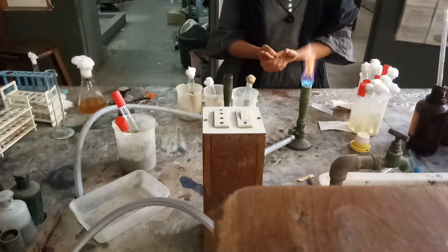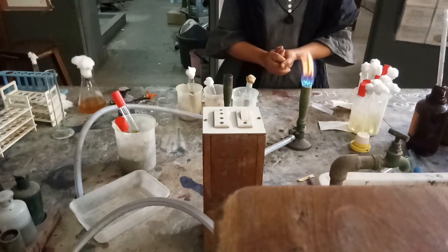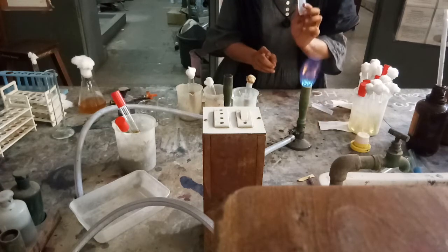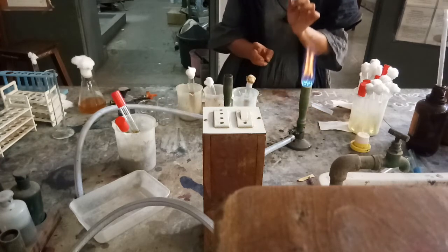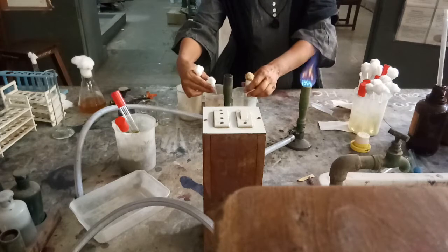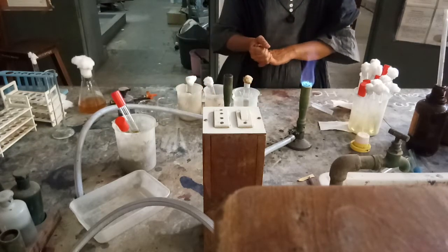In thioglycolate broth also, if anaerobic conditions are sufficient, we are going to see the growth of anaerobic bacteria if they are present in this pharmaceutical product. We are going to check whether it is sterile or not. If it is completely sterile, then we will not get any growth in any tube. But if there is growth, we will compare it with the controls and conclude our result.